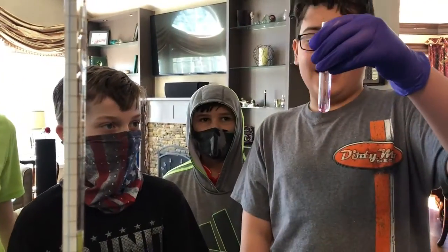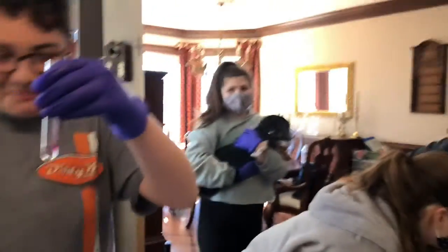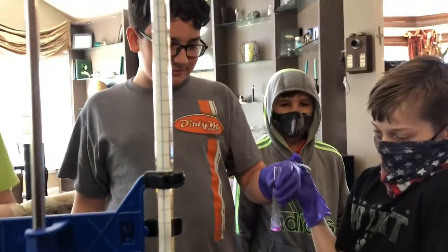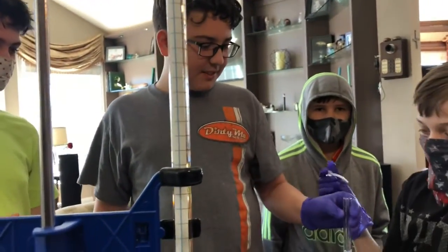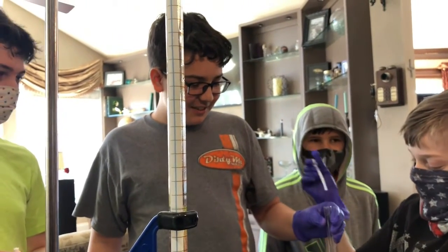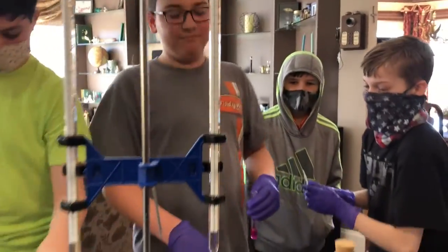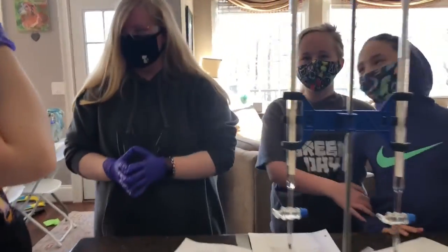But we did it. Shake it. Oh, never mind. Yeah, we don't. No, we don't. We have to clean this up and we have to restart. Shake it. Look at this. What'd you say? We're raising awareness. That was 2 that time. Oh! Yes! So what did you get up to? There you go. What did you get up to?